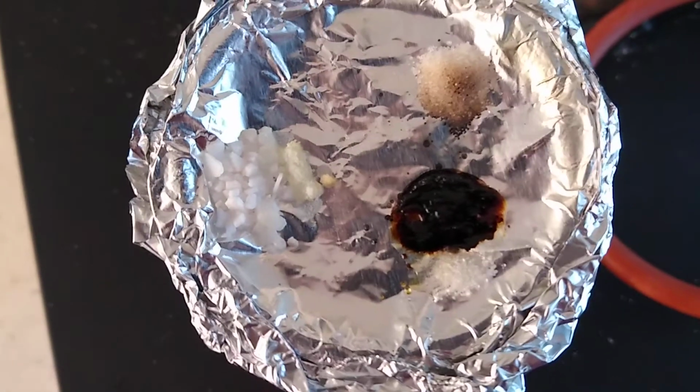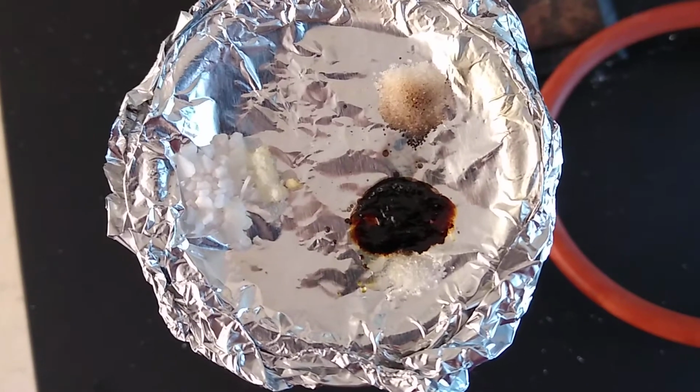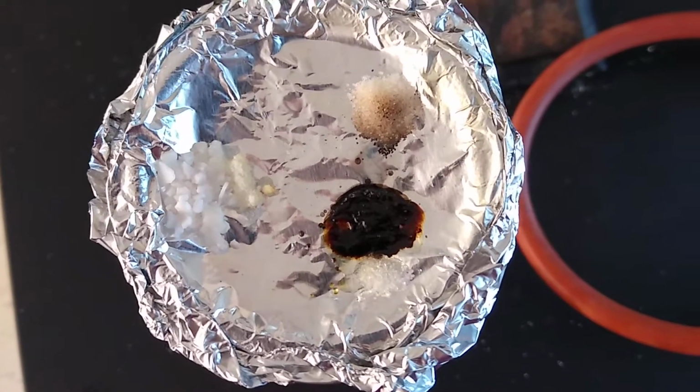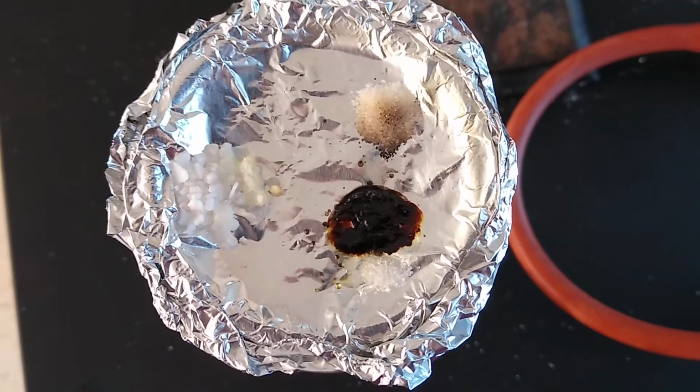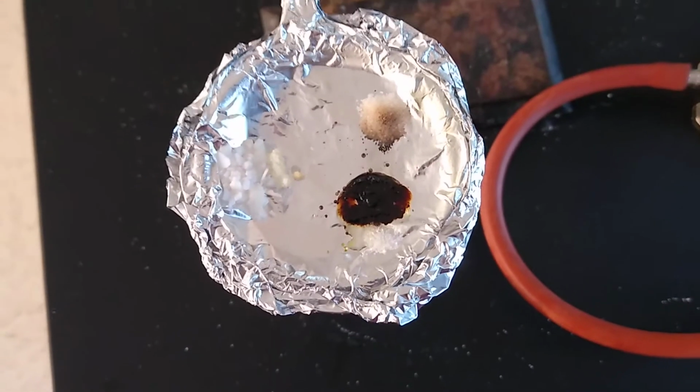So in this given time frame here, we're going to say C had a lower melting point, A and B had higher melting points. So now you should have enough data to go ahead and make your conclusions about each substance as either ionic or covalent, and then turn it in.